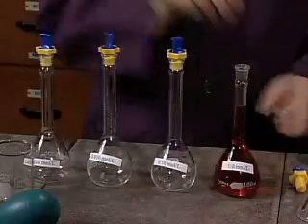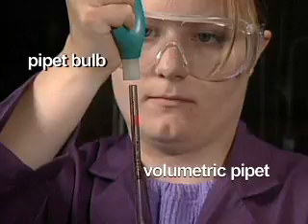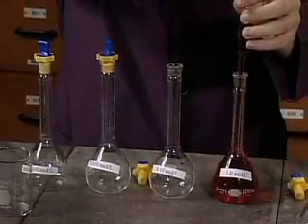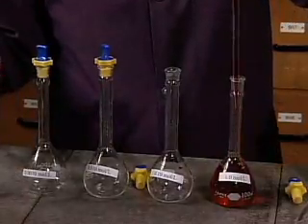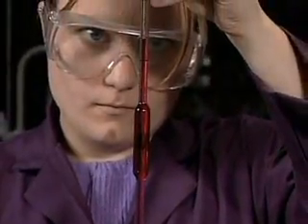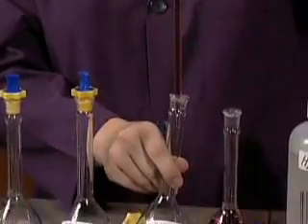The serial dilution begins by extracting 10 milliliters of the original solution using a 10.0 milliliter volumetric pipette and a bulb. Pay special attention to the technique required to use the bulb and pipette. Notice that the tip of the pipette touches the side of the waste beaker as the liquid level drops. An exact volume is obtained when the bottom of the meniscus reaches the calibration line. The 10.0 milliliters are transferred to a new volumetric flask.